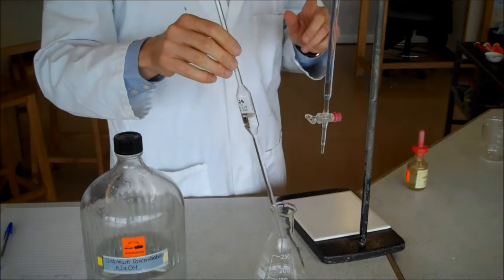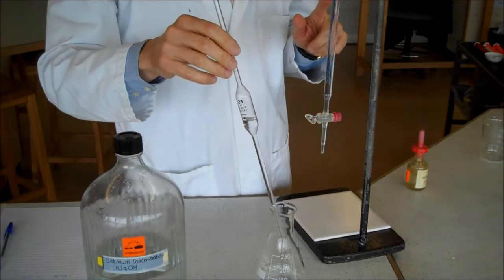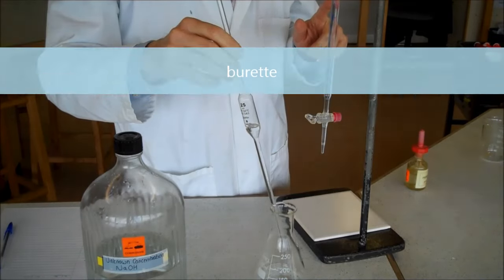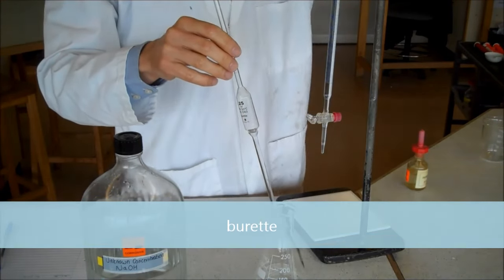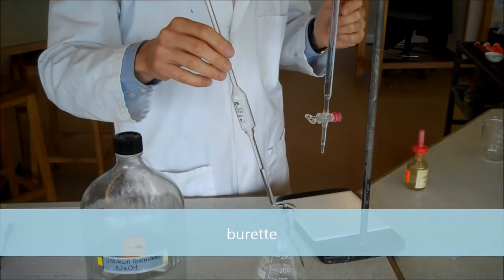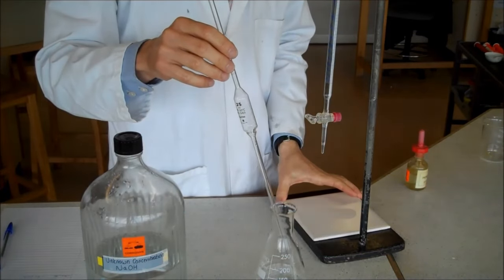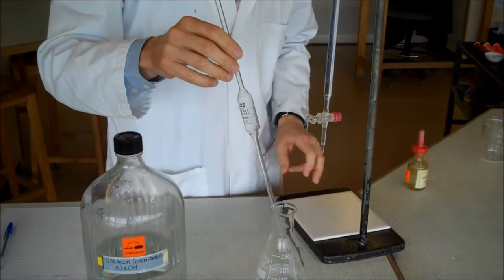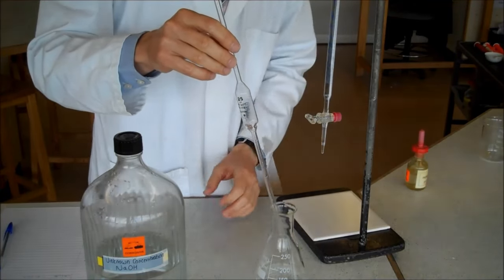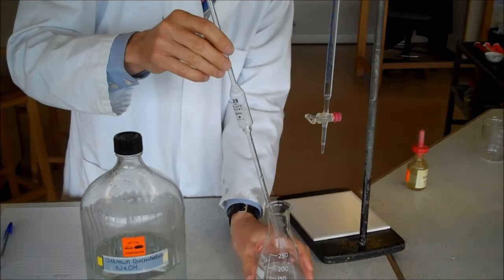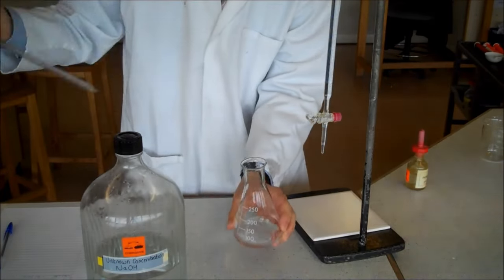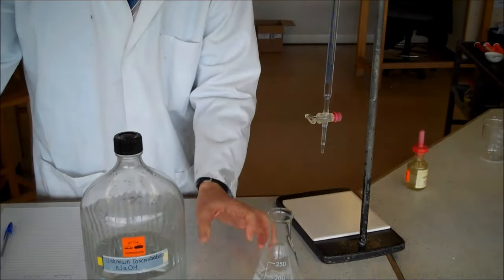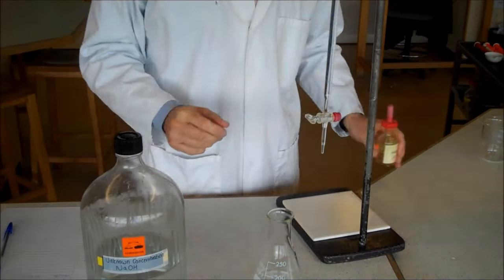In the meantime, I've put some hydrochloric acid in my burette. I've made sure that the burette is reading exactly zero. Underneath the burette, I've put a white tile just to make sure we can see when we've exactly neutralized our reaction. So there's our alkali in there, hydrochloric acid in the burette.